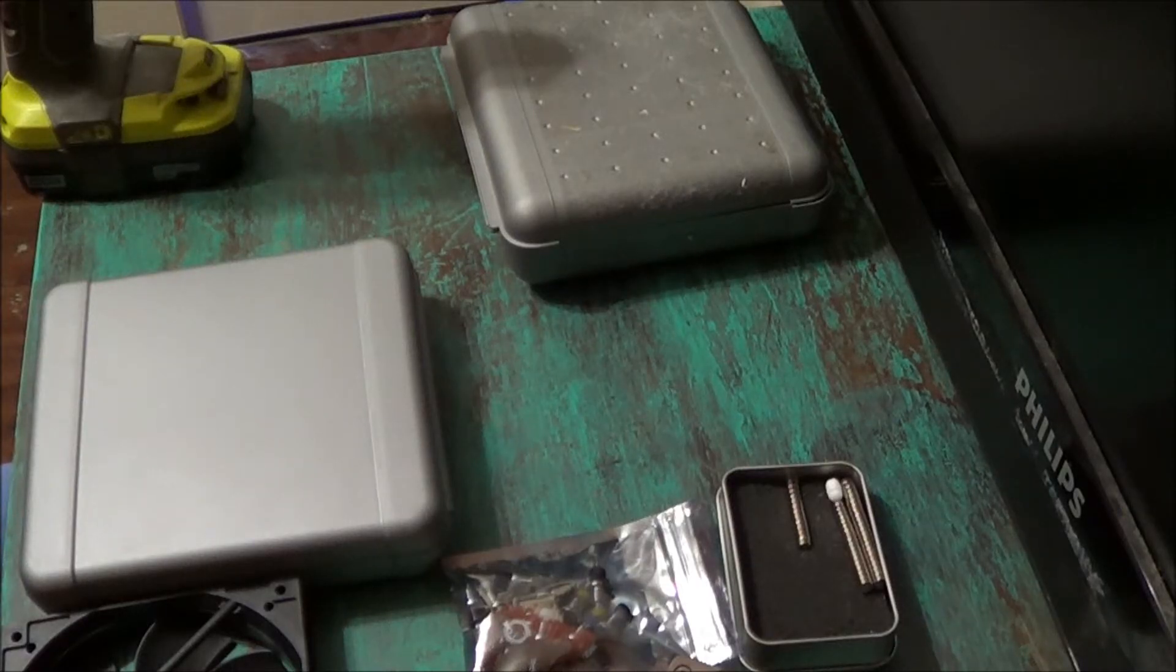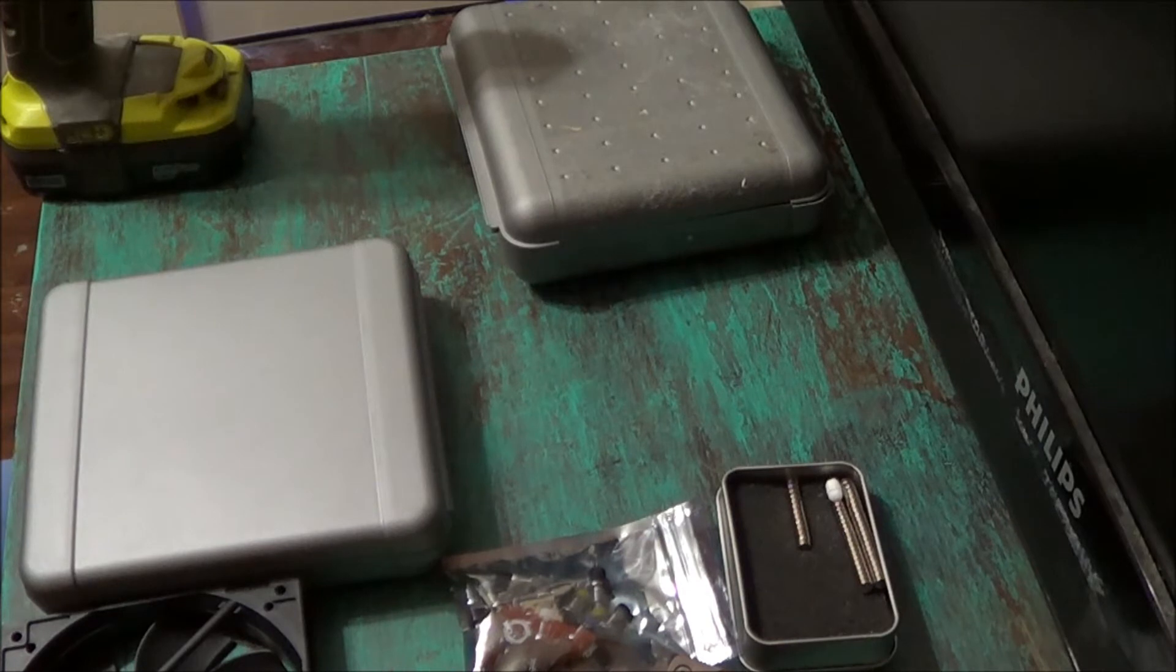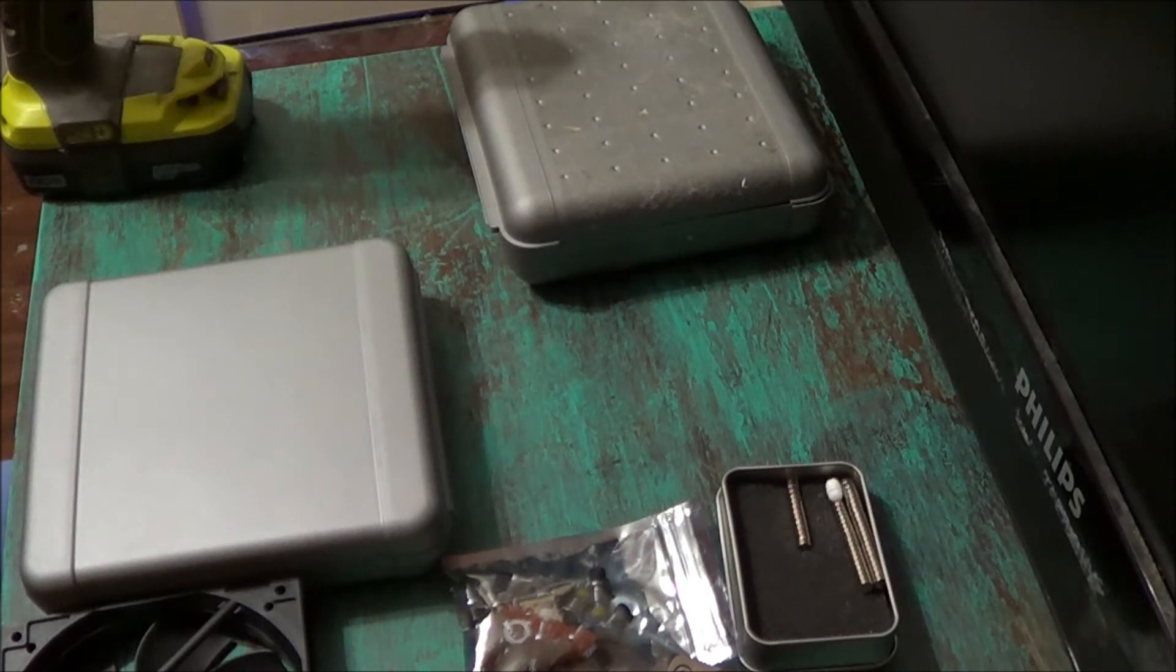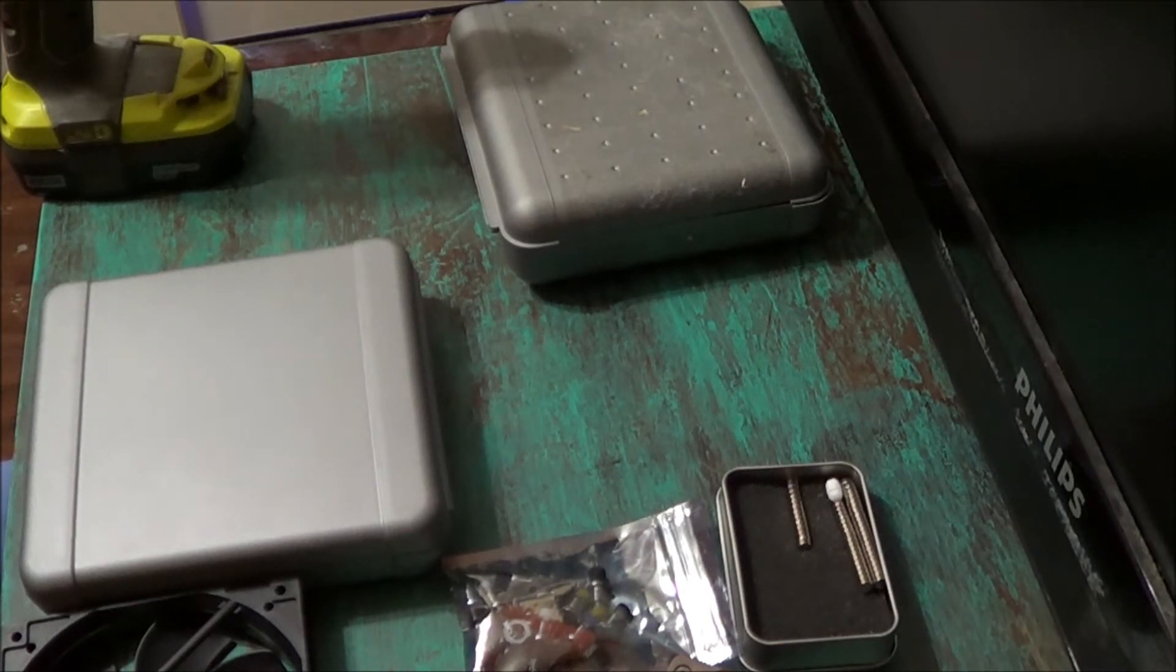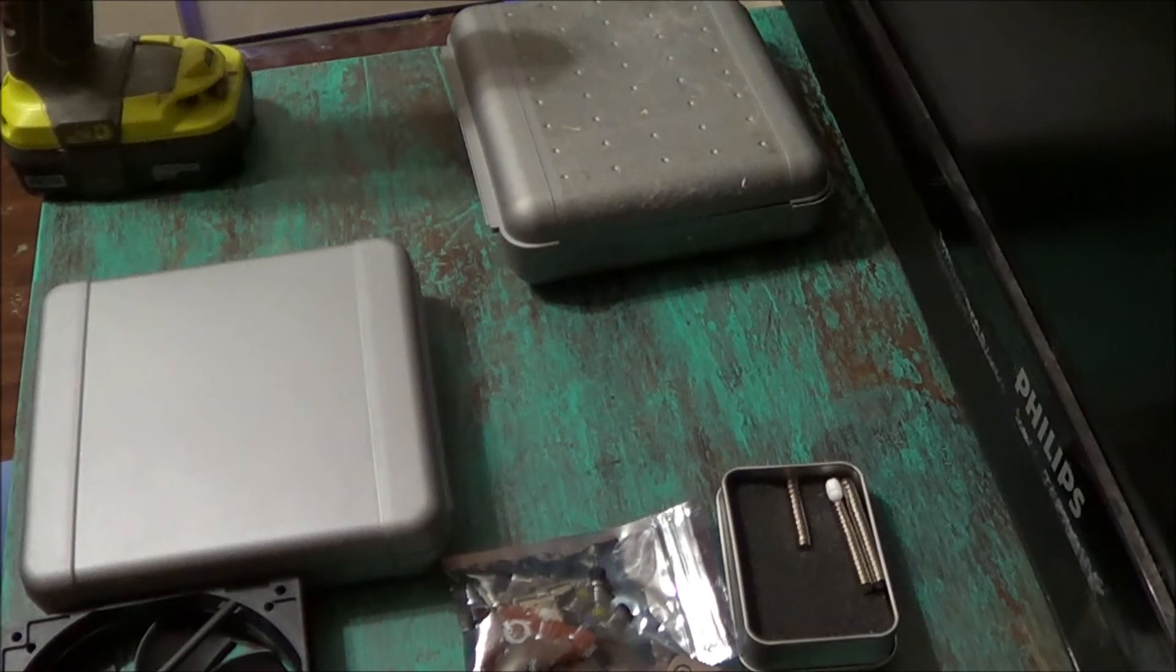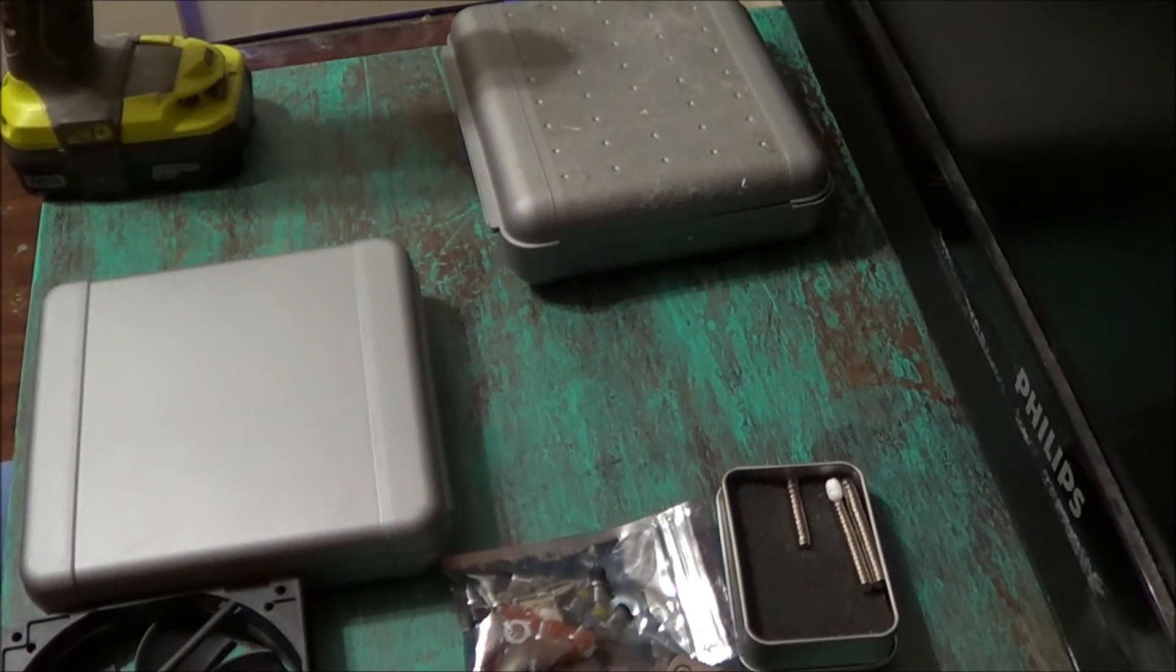Hello everyone, today I'm going to be showing you how to make a magnetic stirrer using just a computer type fan and some magnets.